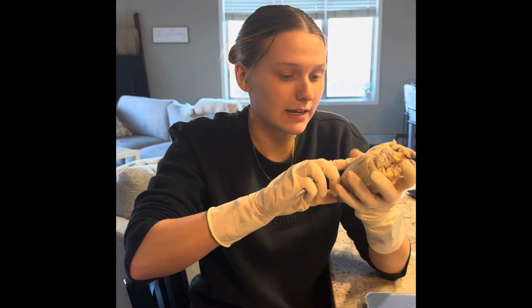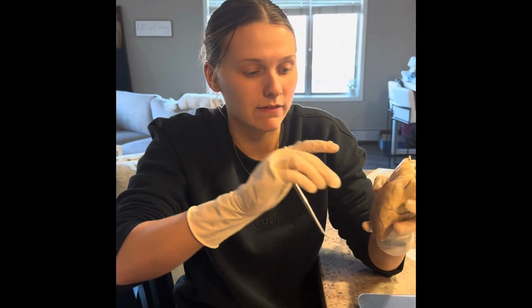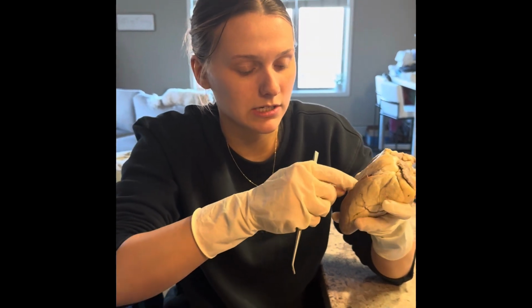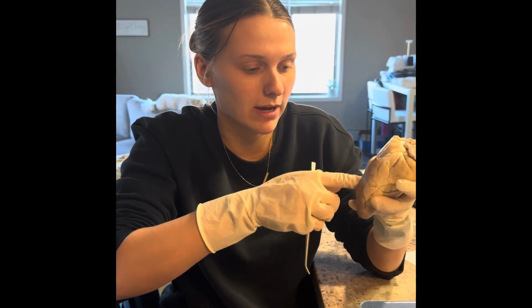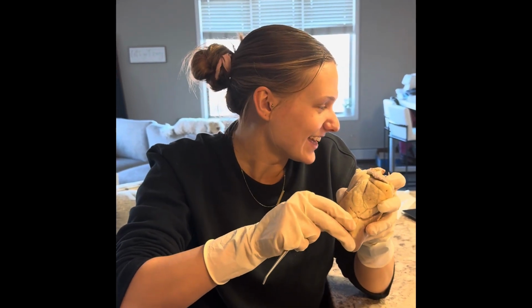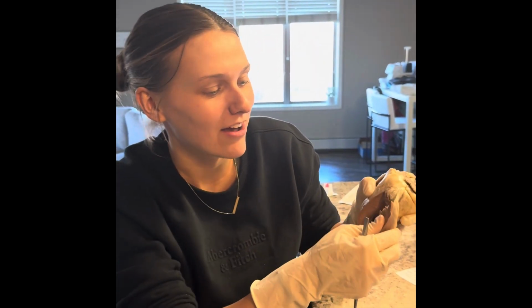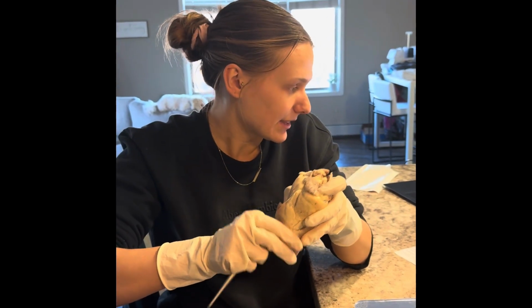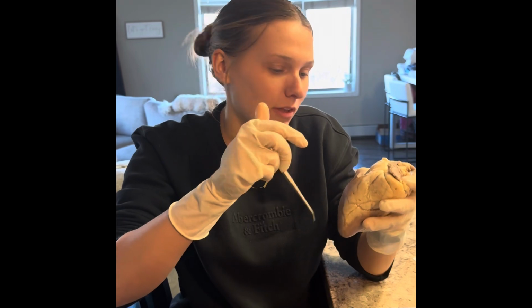And then the next thing is a vein, and veins just kind of run right through here in the heart. It's obviously hard to see within here because there's no active blood. The thing I'll talk about is the trabeculae carneae, and that is within the heart as well. It'll be hard to see, but those are the ridges and folds on the walls of the ventricle.